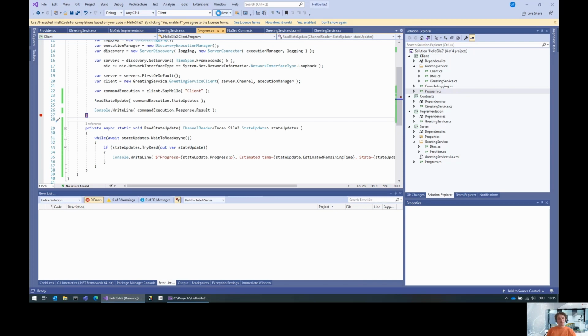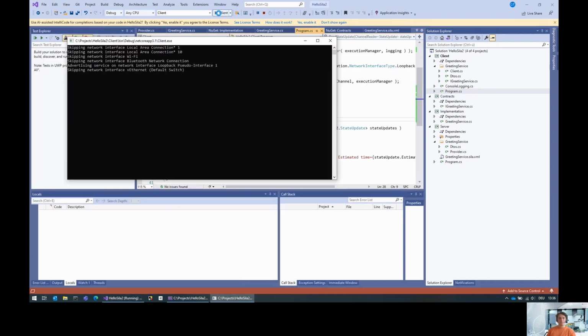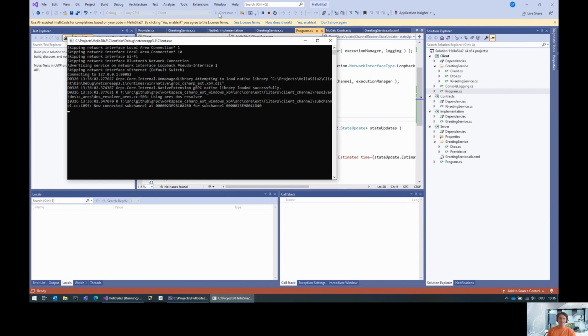I forgot to put it right here before it's closing. So let's do it again. The first delay that we see here is actually the discovery, because I put a timeout of 5 seconds for the discovery. Then we get this message that we don't have any progress and the state is not started. Then we get a second message saying that the progress is 50% and it's running, and we'll soon get the third message that it's completed.